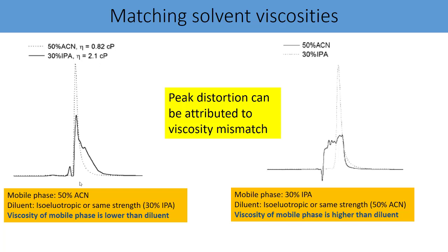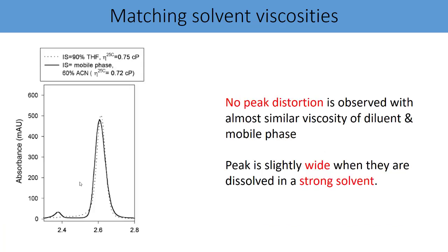So you can attribute this finding to the viscosity mismatch. The viscosity of the mobile phase and the viscosity of the diluent have a huge difference, and because of that you are getting distorted peak shapes. In case you reduce the viscosity difference, and here is the example onto your screen, the diluent and mobile phase are having almost similar viscosities. The mobile phase is having the viscosity of 0.722 cp, which is 60% ACN.